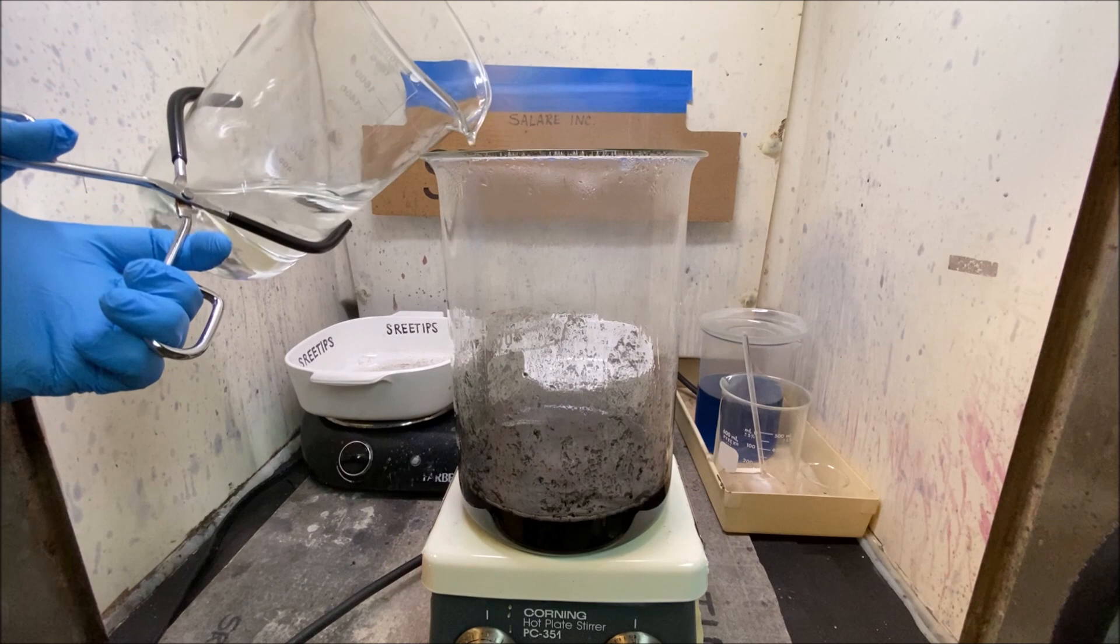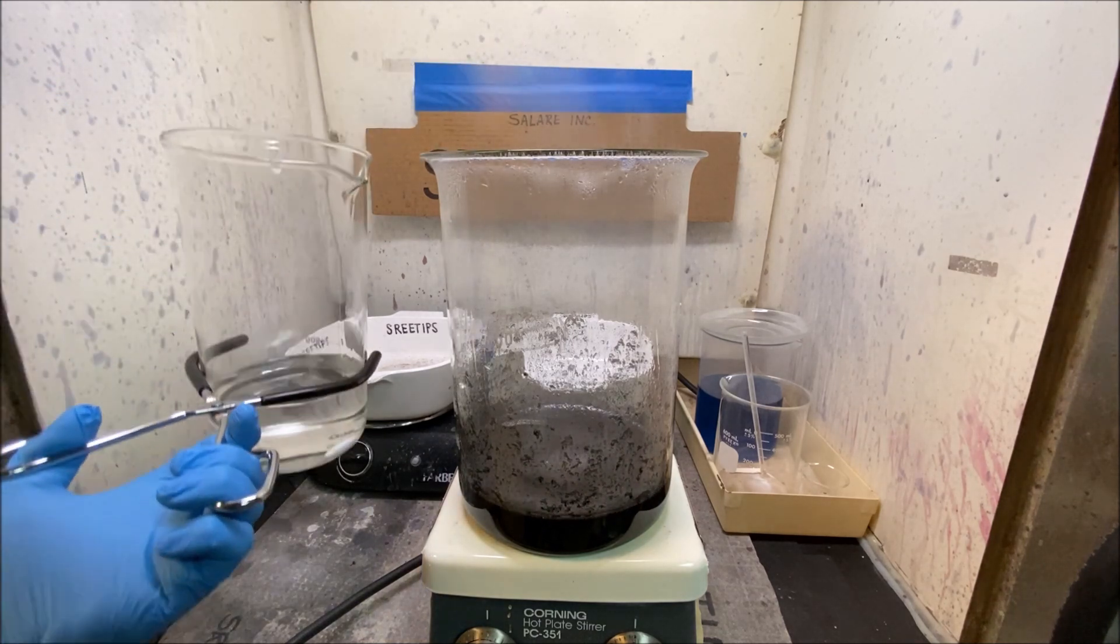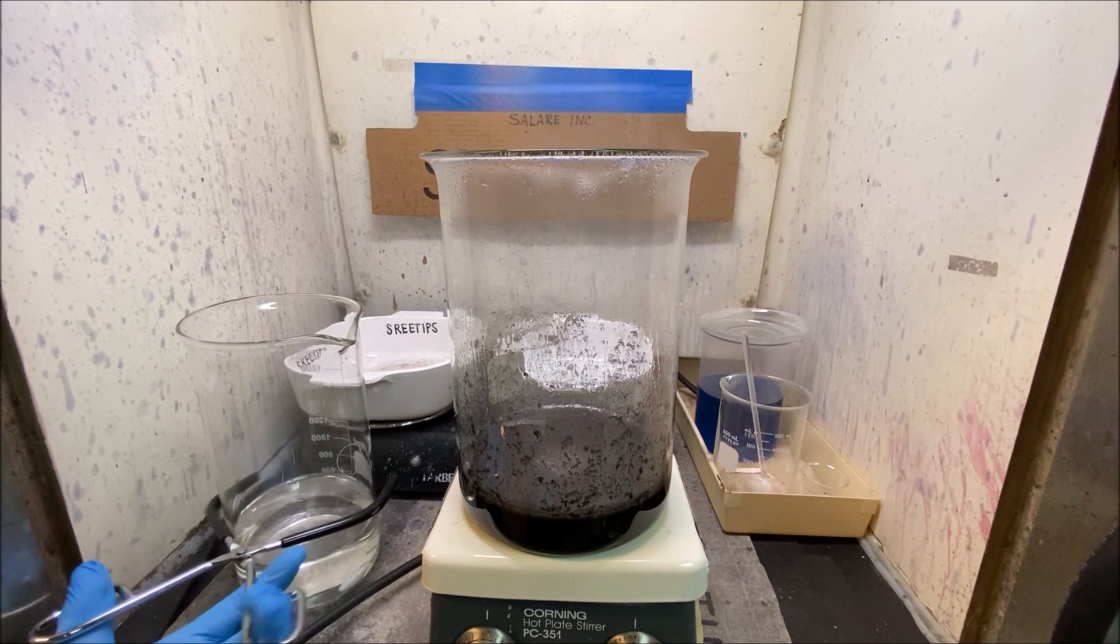All right, I think we got everything reduced. Man, that was fast.